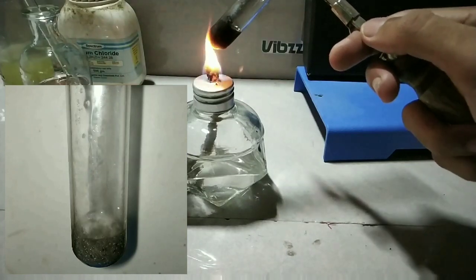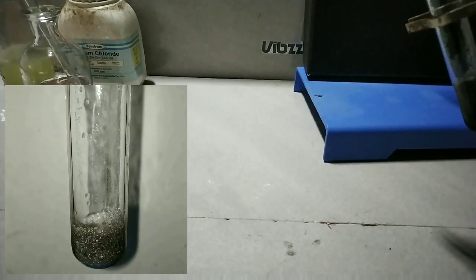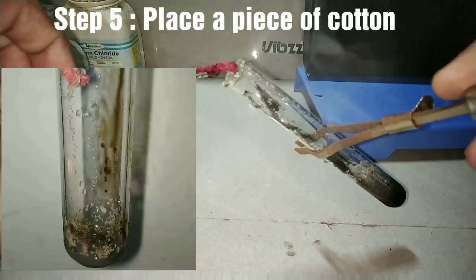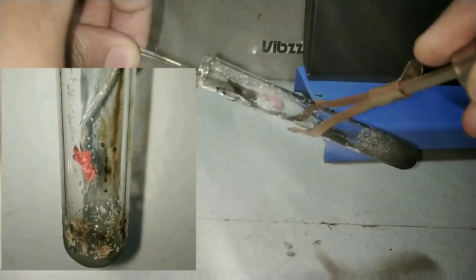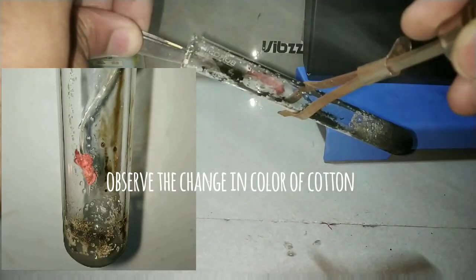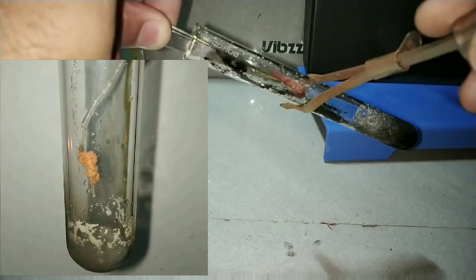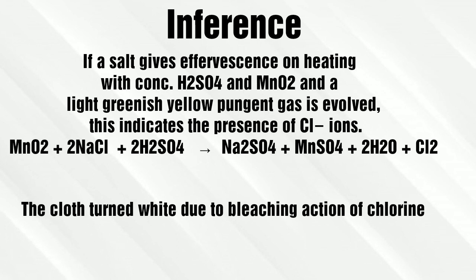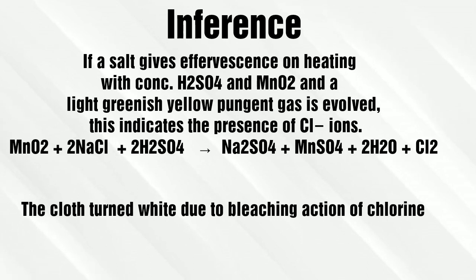You can observe the reaction taking place. Now we heat the contents of the test tube. While heating, we observe the vigorous reaction taking place — chlorine gas is being produced. Now we test the presence of chlorine gas by placing a piece of red wet cotton into the test tube. After a few moments, you can observe the change in color of the cotton — it is turning pale, losing its red color and turning white. Greenish-yellow chlorine gas is produced by the action of manganese dioxide and sulfuric acid on the chloride salt, which bleaches the cloth.